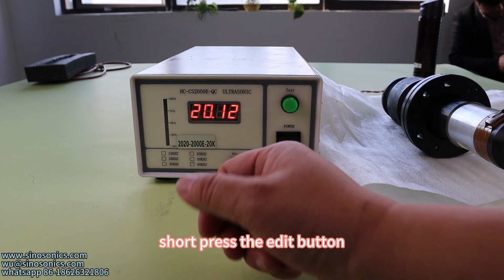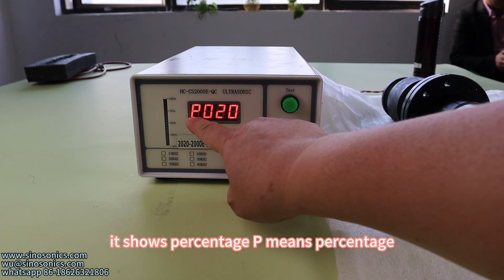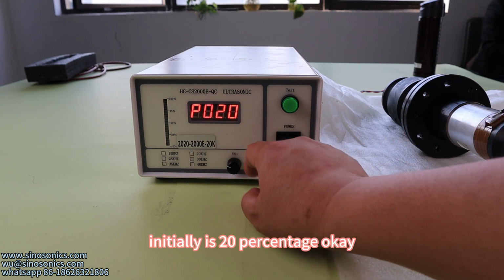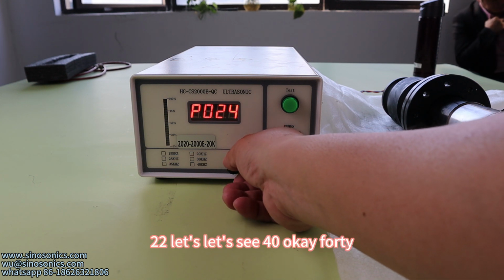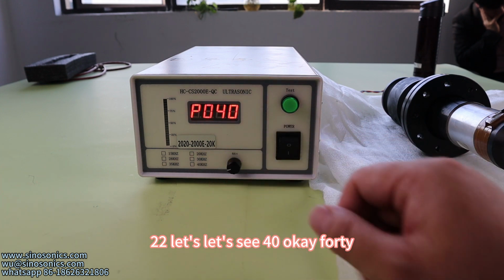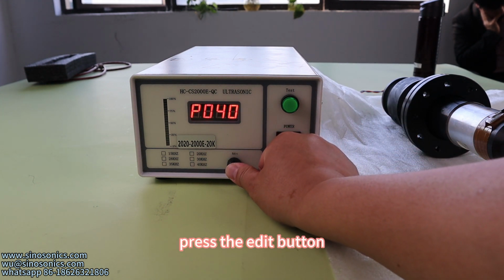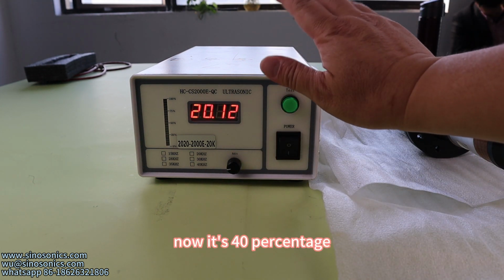Now I'm gonna show you how to change the power percentage. Short press the edit button. It shows the percentage. P means percentage. Initially it's 20%. Spin the button. 22. Let's say 40. Press the edit button. Now it's 40%.